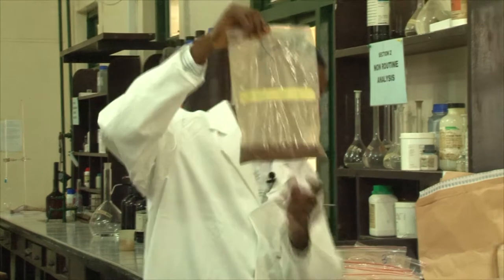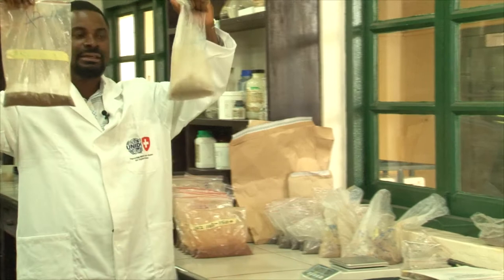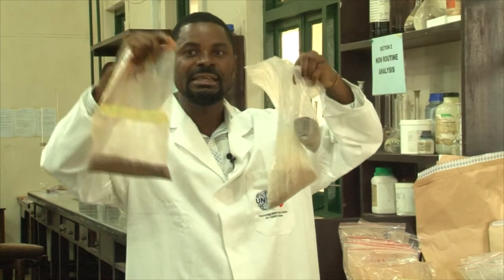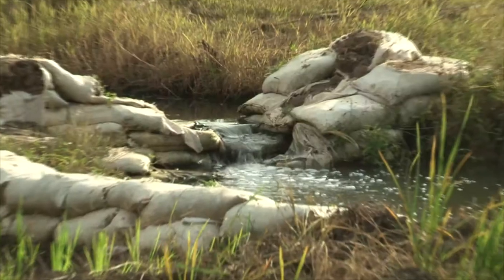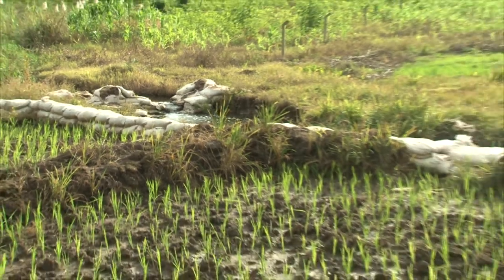The CSIR Soil Research Lab tests soil to know its nutrient level and to ascertain whether there is any contamination which may hamper plant growth, or whether it is likely to endanger the lives of consumers, because a dangerous element in soil is absorbed by plants. The farmer may want to know if there are any limitations in the soil — like is my soil acidic, is it saline? We are able to run all these tests like pH and electrical conductivity to be able to give recommendations.